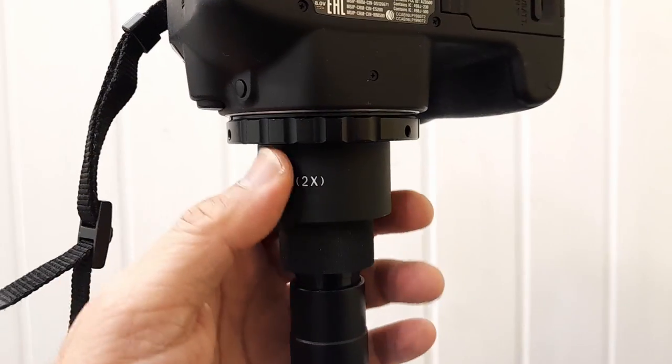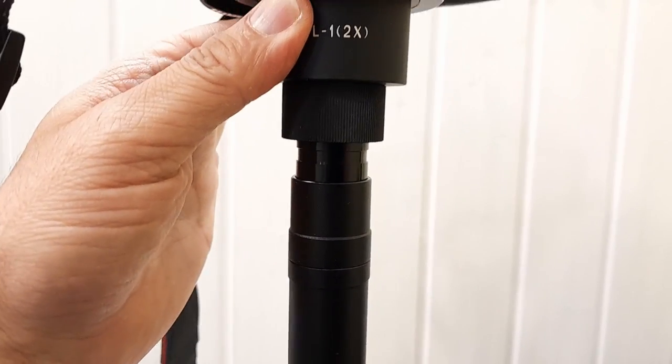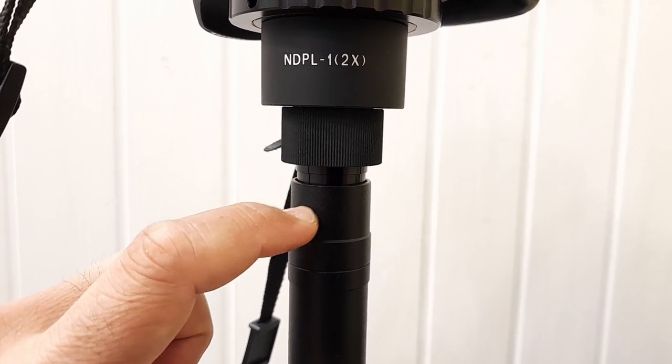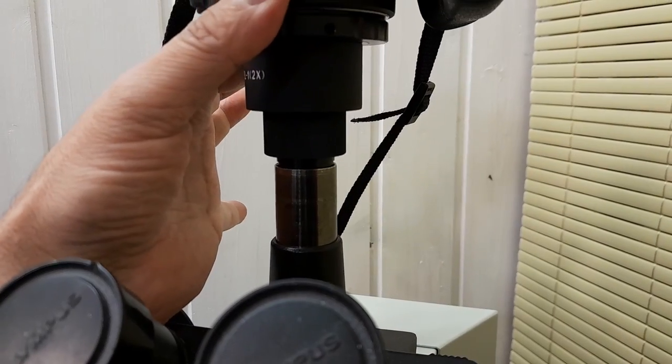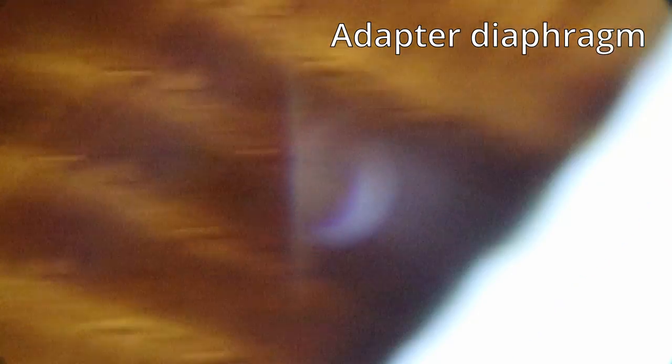But that's not the whole point. Now, when I put it into one of my microscopes, I could see that it didn't go all the way in because the diameter was not quite correct; at the top part, it didn't go in. But in my second microscope, I had no problems. So this is now how it looks.